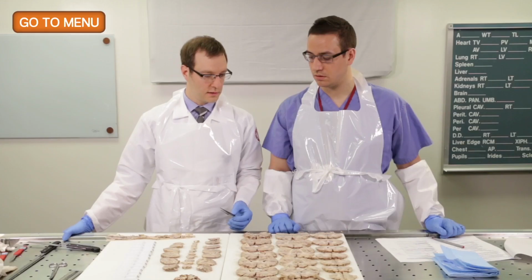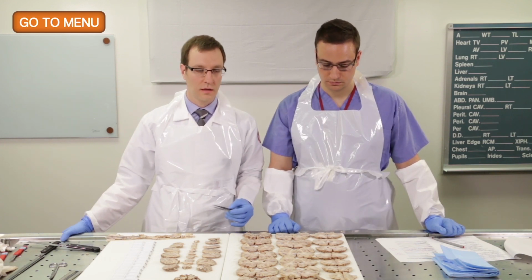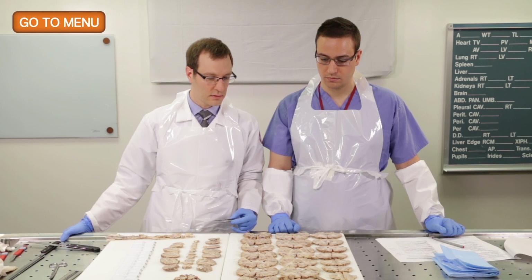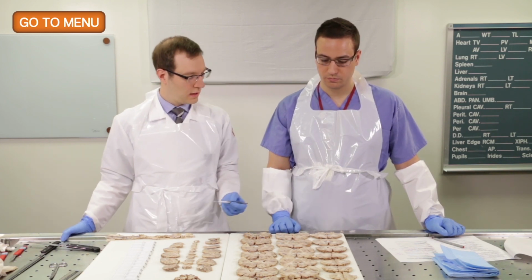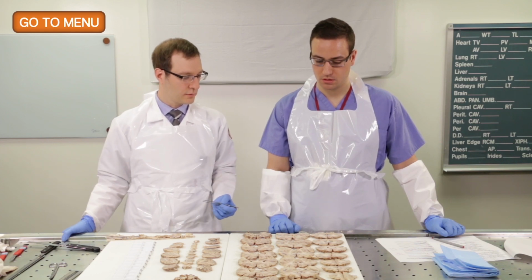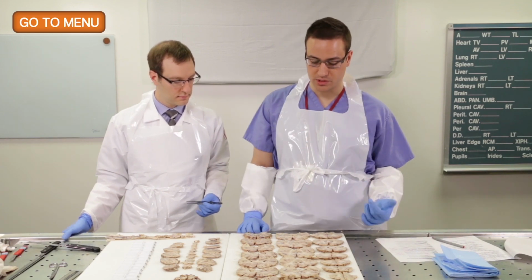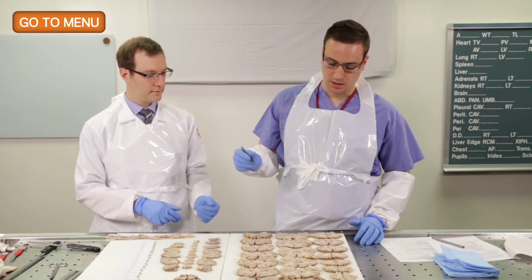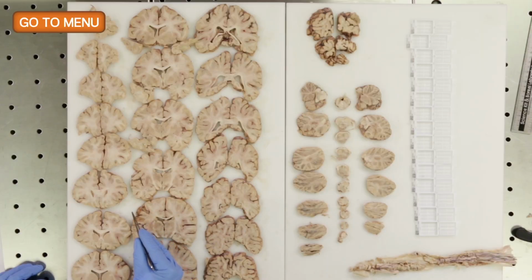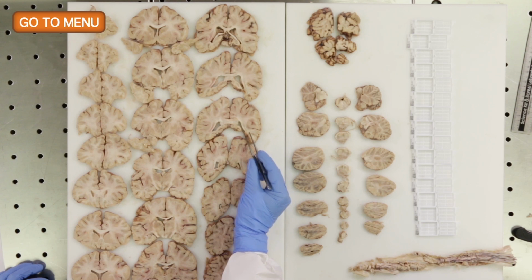So at this point we would look for any gross lesions. Obviously we already know a little bit about where to look because we saw some lesions exteriorly, so we want to correlate that. So Dr. Fulmer, could you point out where some of the lesions consistent with chronic infarction are that we saw? Sure. So the large lesion that we saw on the anterior surface of the brain in the motor strip is this area right here. Right. We also have the lesion in the occipital cortex, which is in this area here. Right on the right side.